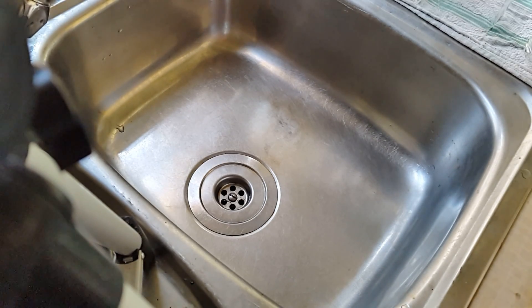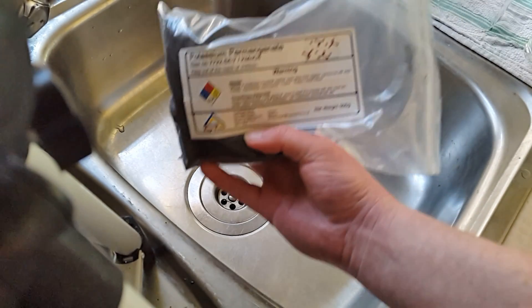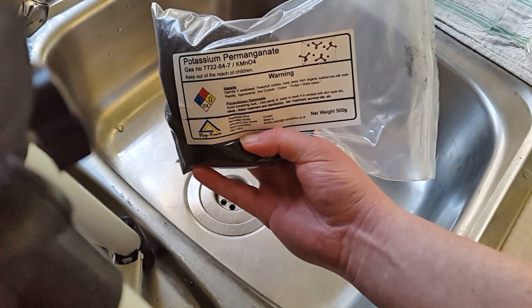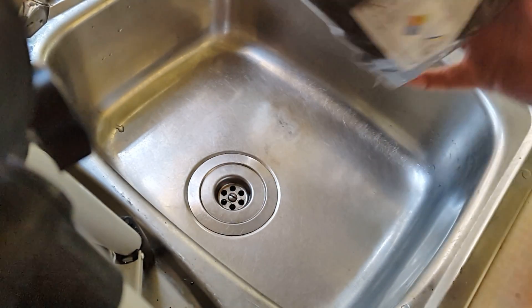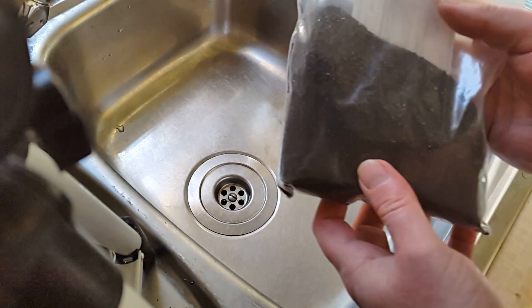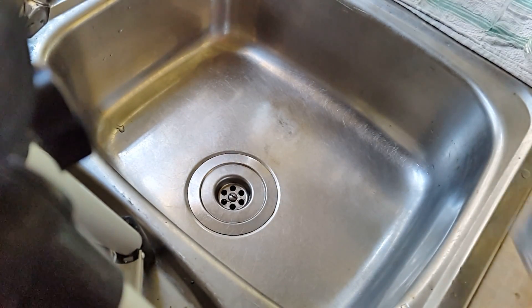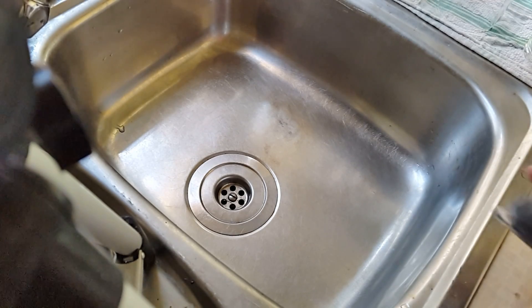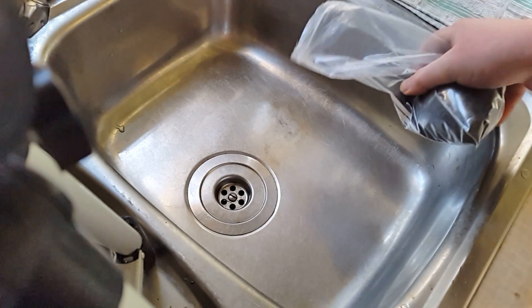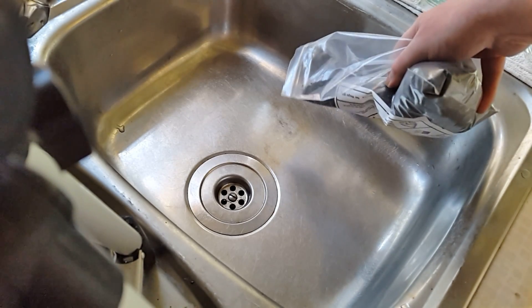Part of this other experiment — I did a bit of a teaser months ago. Potassium permanganate. Keep that out of reach of children. It's got a brilliant quality because it looks sort of like black, but put it in a bit of water and it goes really bright pink and stains. Do not put it in your girlfriend's, boyfriend's, husband's, or wife's hair as a joke — it doesn't go down too well, even though it is quite funny. And it stains everything.